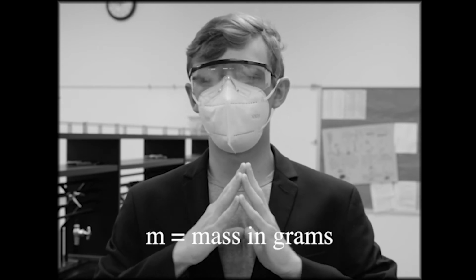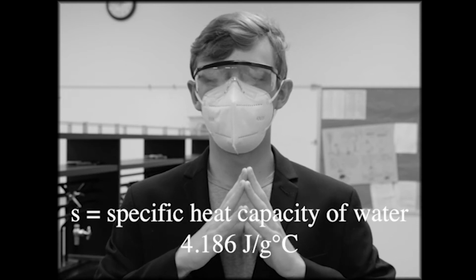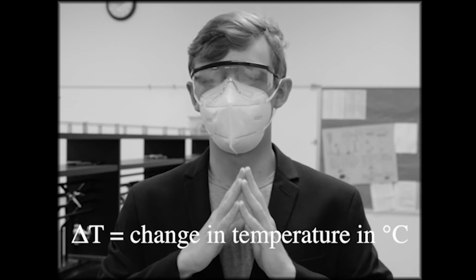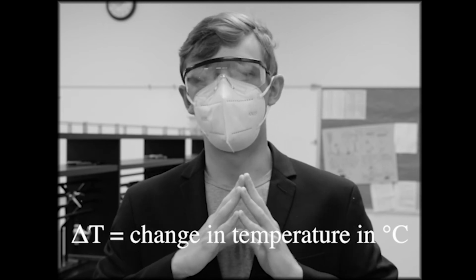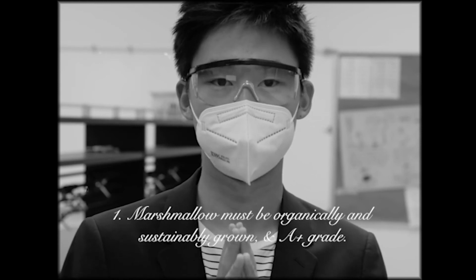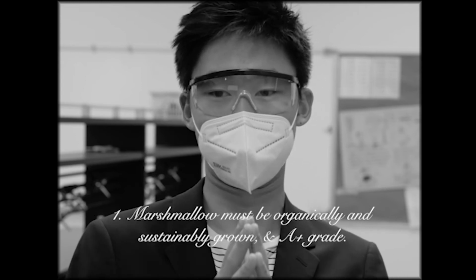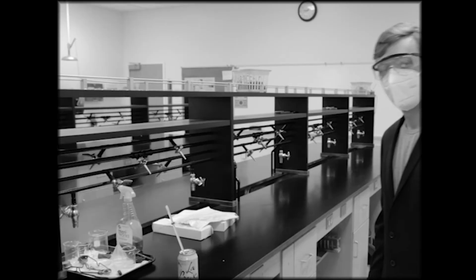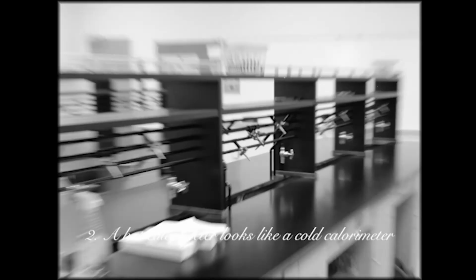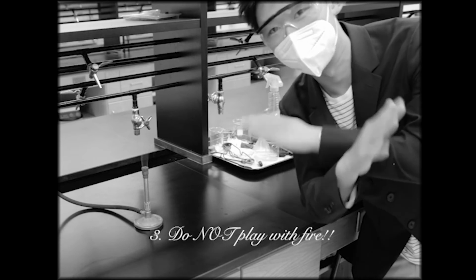M will be the mass of everything inside of the calorimeter, S is the specific heat of water, 4.186 joules over grams degrees Celsius, and delta T is the change in temperature of the contents of the calorimeter in degrees Celsius. Here are some safety tips. 1. Make sure your marshmallow is organic and sustainably grown, an A+ grade. A hot calorimeter looks like a cold calorimeter. Wowza! Now, although it's tempting, don't play with fire.